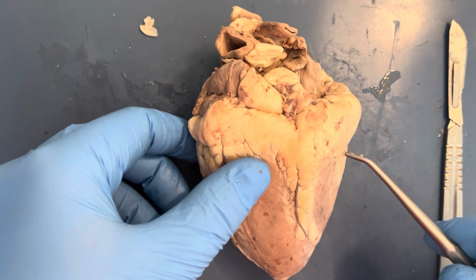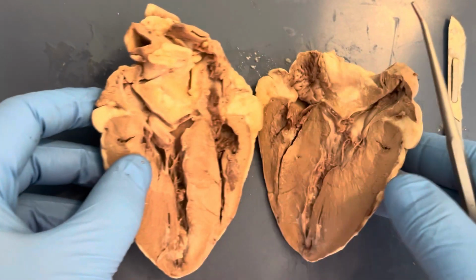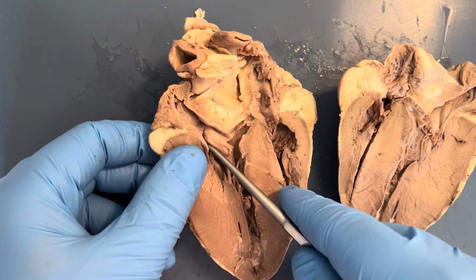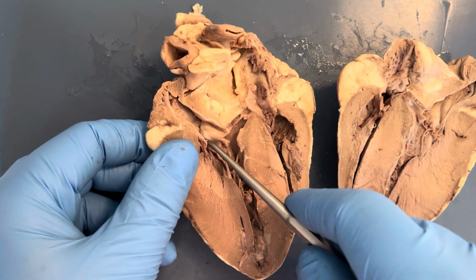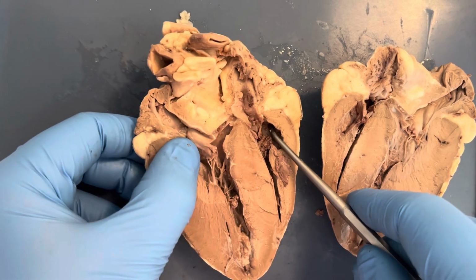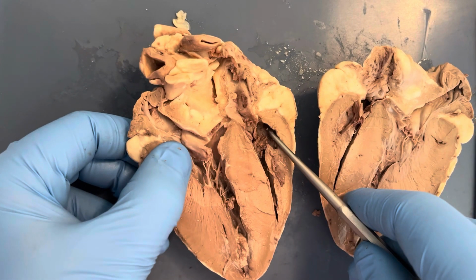heart. When opening the heart, we start on the right side, which contains the right atrium, and it carries deoxygenated blood from the systemic circuit of the body and later pumps it into the right ventricle. I quickly point over to the left atrium, and after the gas exchange occurs and the oxygenated blood is carried out from the pulmonary system, it enters the left atrium. Like the right atrium, the blood is pumped down to the ventricle.